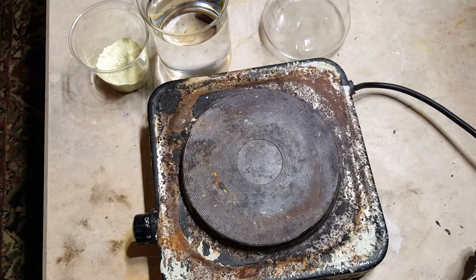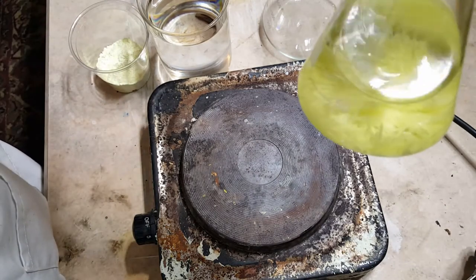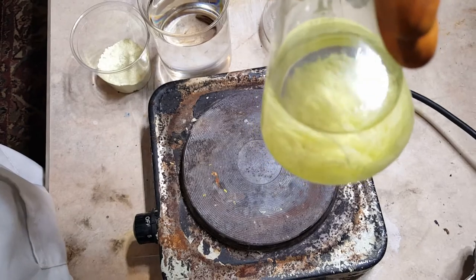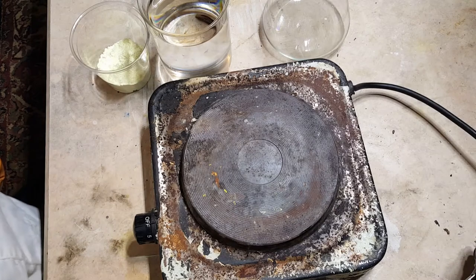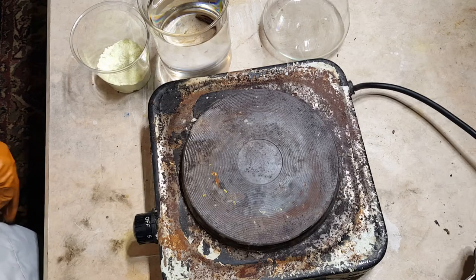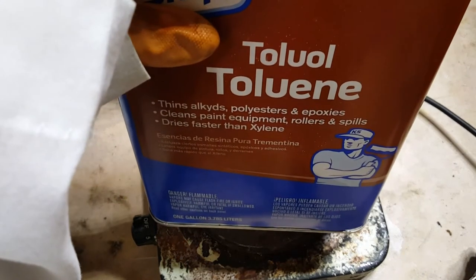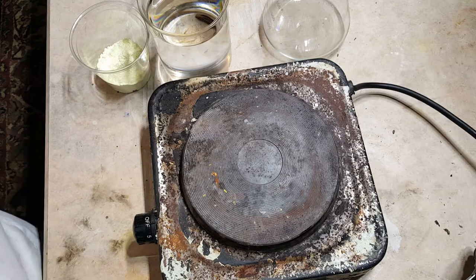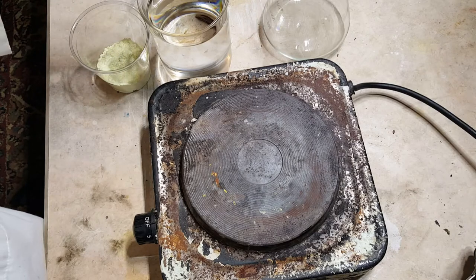Before I finish up, I'm going to show you one more fun experiment with sulfur: how to grow sulfur crystals — in this case, monoclinic needle-shaped crystals. To do this, you need to dissolve sulfur and get it to crystallize back out. Sulfur doesn't like to dissolve in very many things, but it will dissolve in hot toluene, which you can get simply by buying it from the hardware store in metal containers.